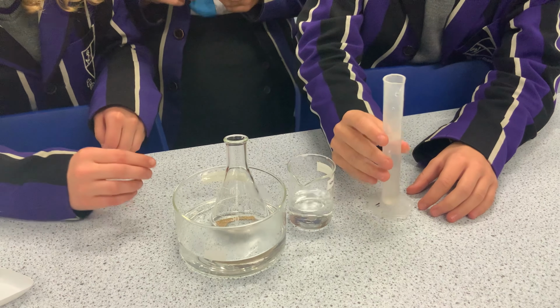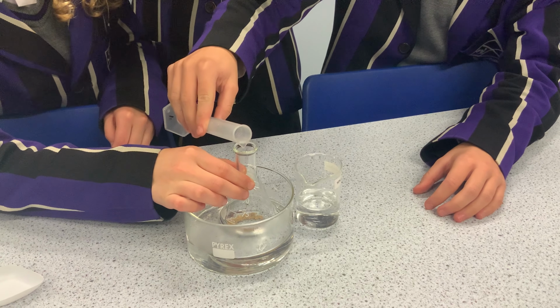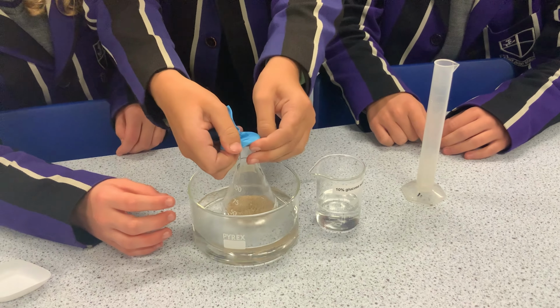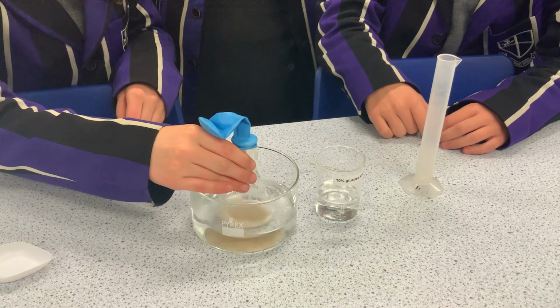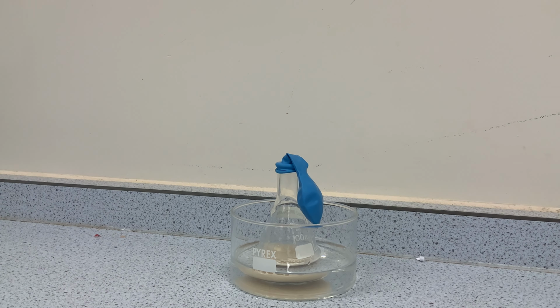After adding yeast and sugar, students would then immediately attach a balloon to the mouth of the flask to ensure no oxygen gets into the flask, so anaerobic respiration can occur. Students should also swirl the flask to thoroughly mix the content. The setup can then be left aside. Towards the end of the lesson, the balloon should stand upright as carbon dioxide is formed in fermentation.